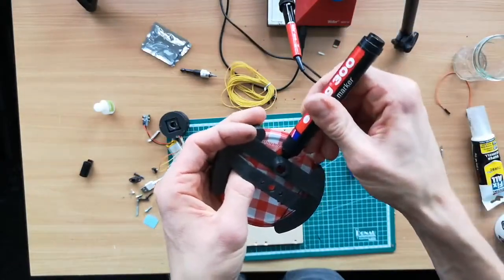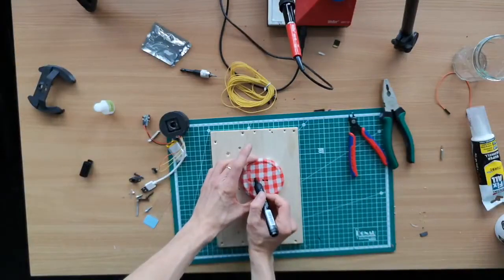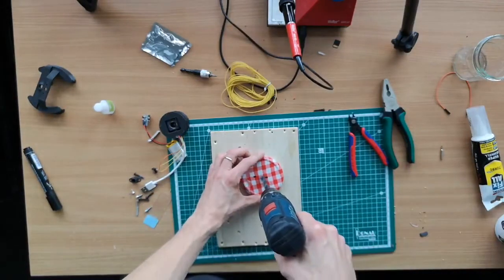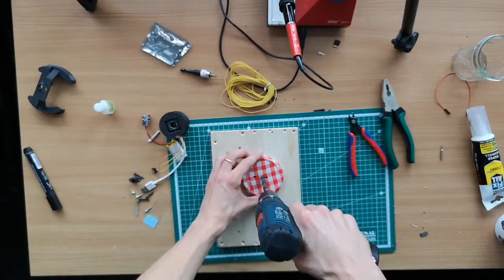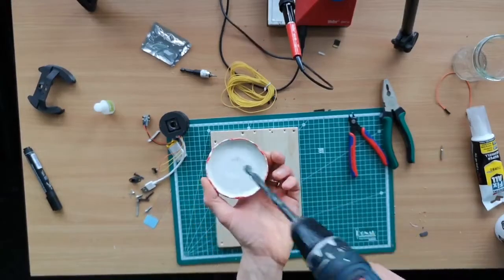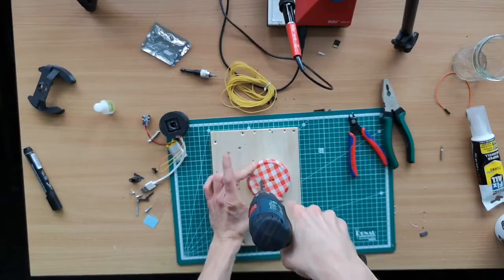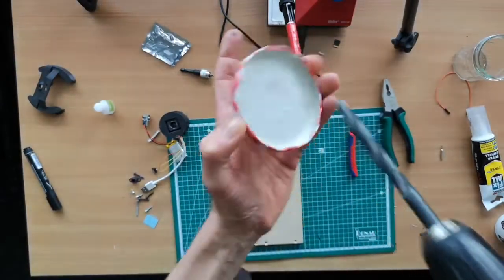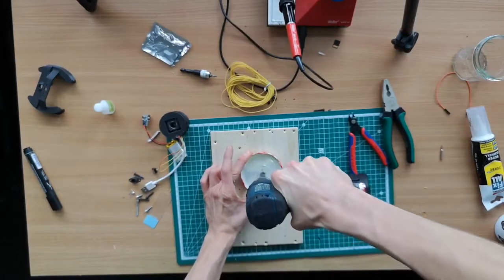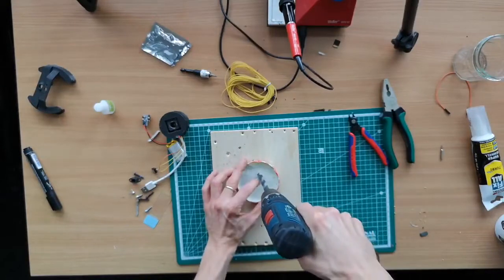So I'll just do it here. And then we use the drill bit and make a hole right here, and then in the center again. Be careful, it can be dangerous, because it can start flapping around. So what I'm going to do now is first marking it and then drilling it from the other side. So you see that there's a mark, because otherwise it might be really difficult. So you see the two marks. It's easier to drill like that because then you have something underneath. And then with the wood. This is the first hole, and then the second.